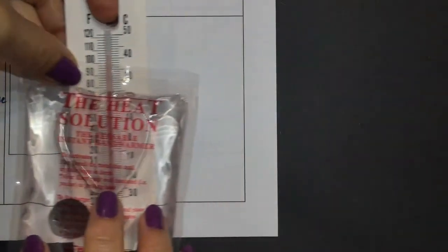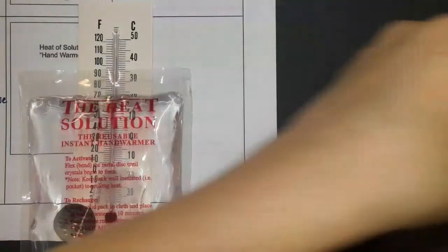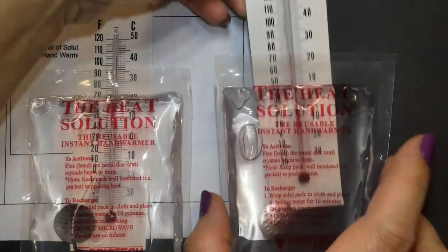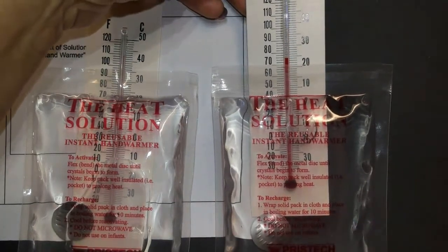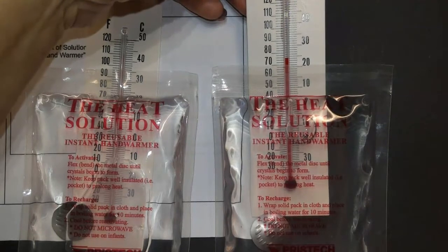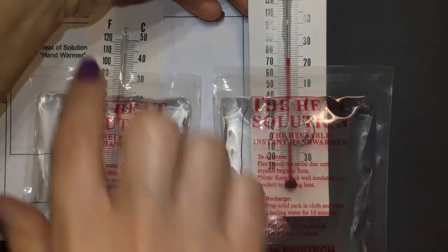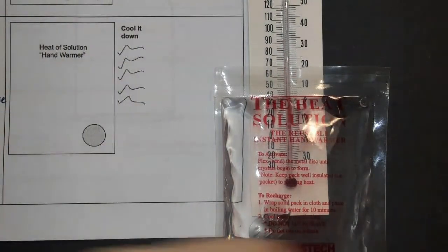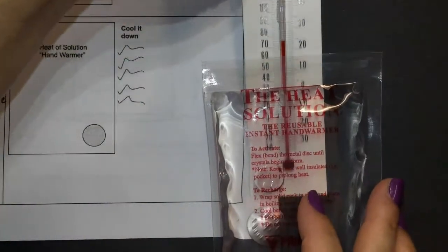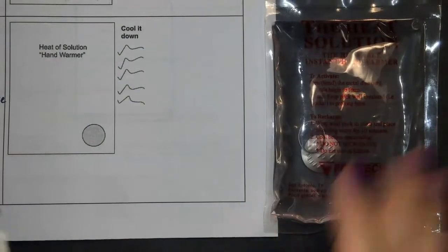So if I want it to be supersaturated again, I'm going to have to cool it down. So this one currently is at about 76 degrees. And so you'll notice it was cooled down quite a bit from after I heated. And so this is now currently back in a state of being supersaturated.